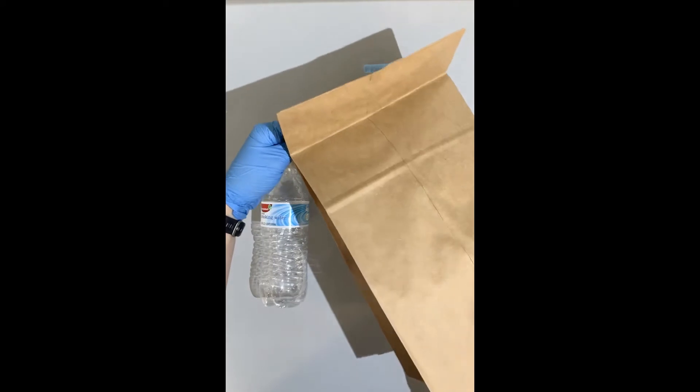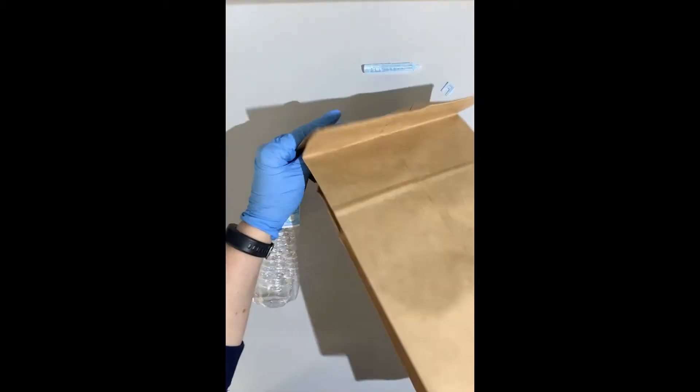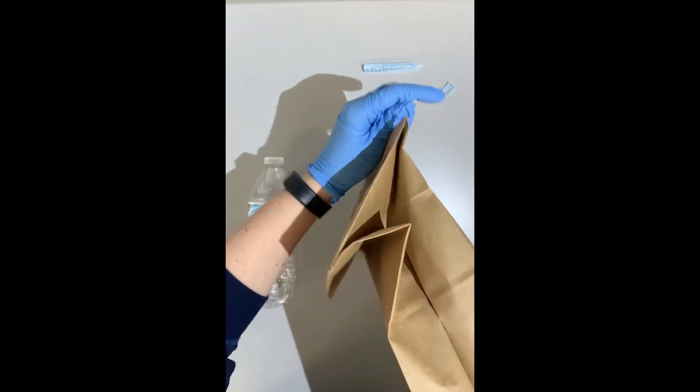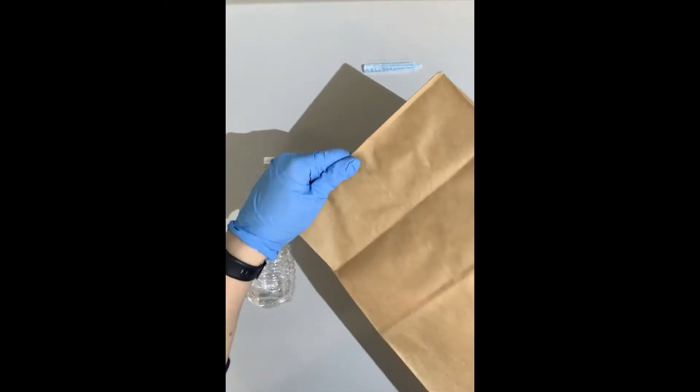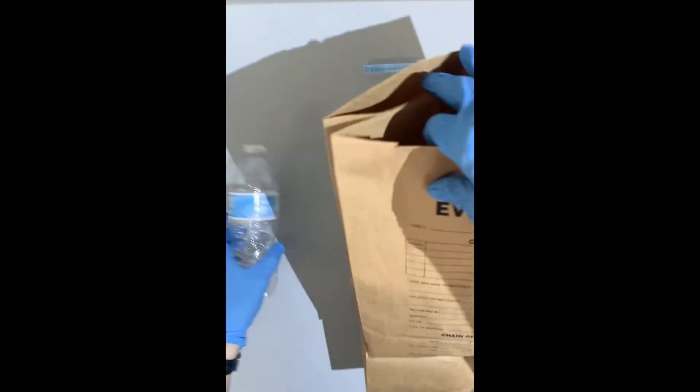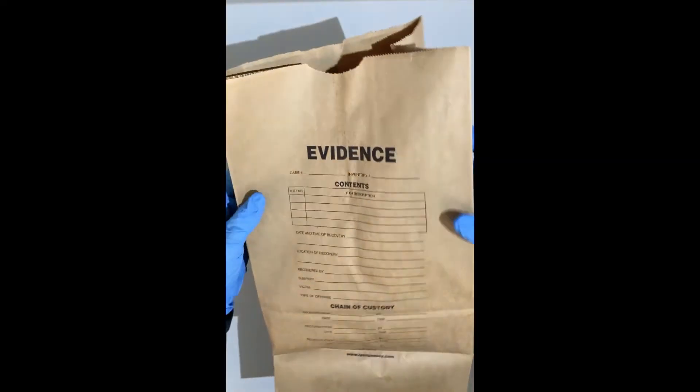For our empty water bottle, open up our evidence bag and just throw the item in there.